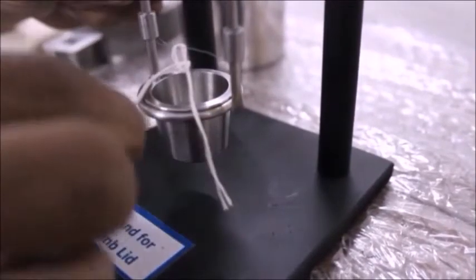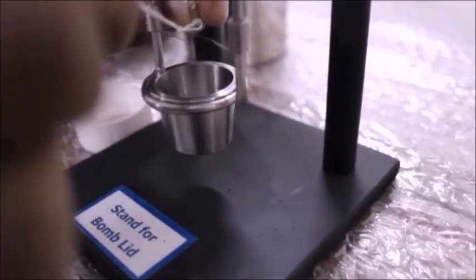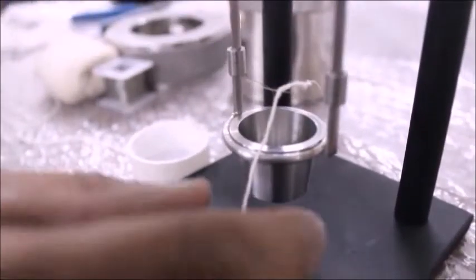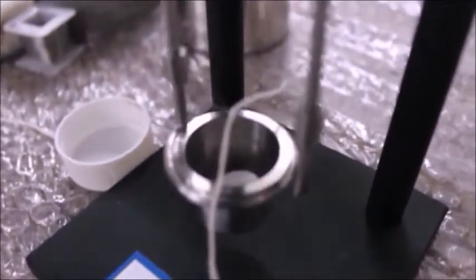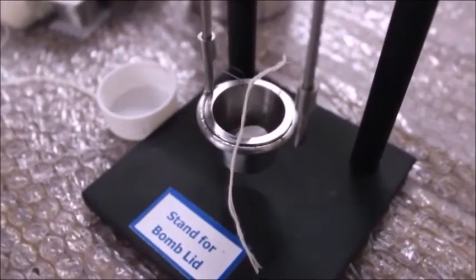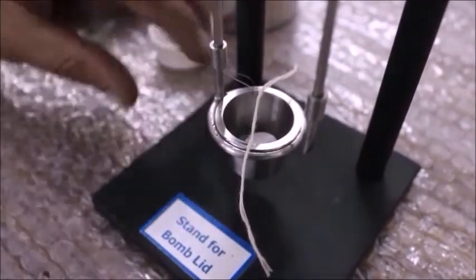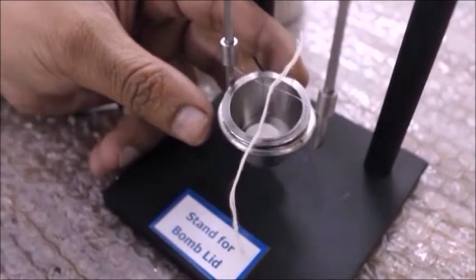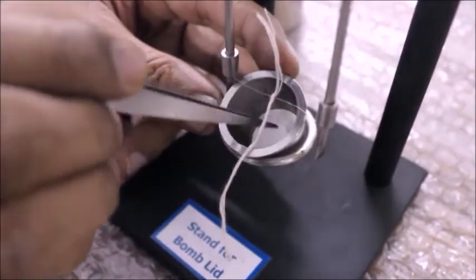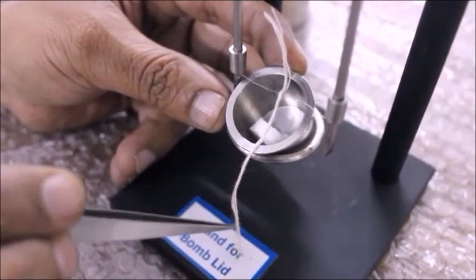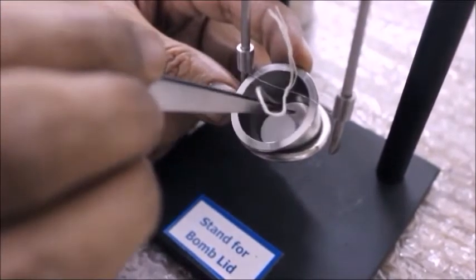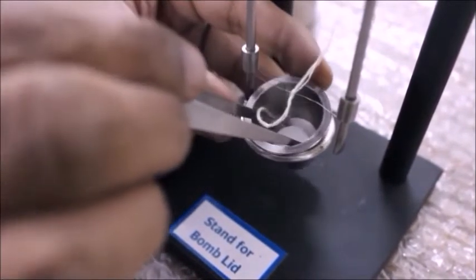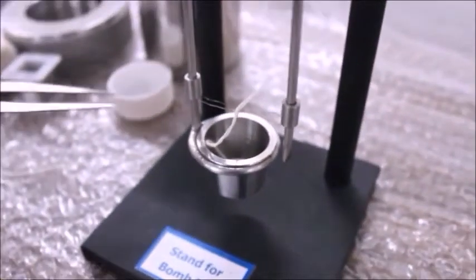Place the sample item, in this case benzoic acid, on the longer thread like so. This is done to complete the circuit to ensure proper burning of the sample item.